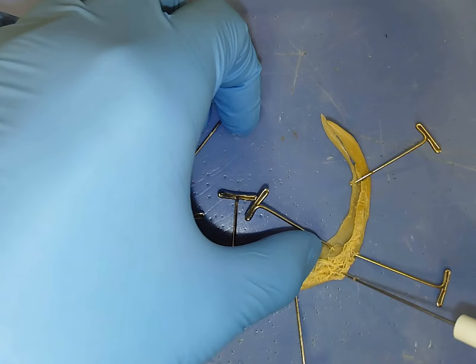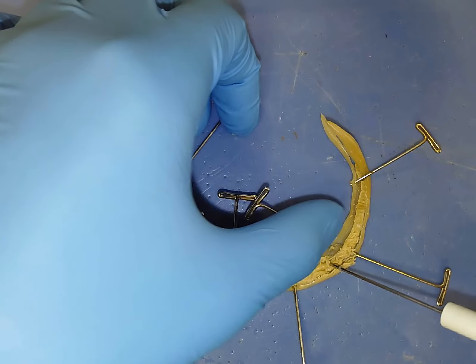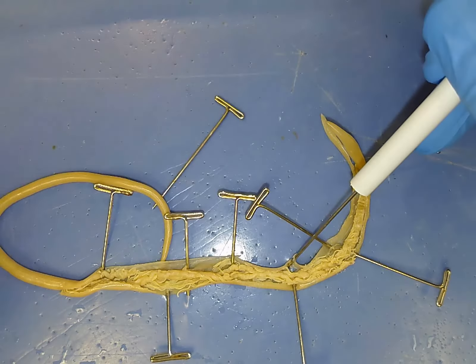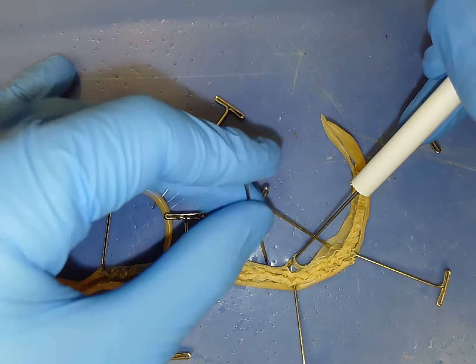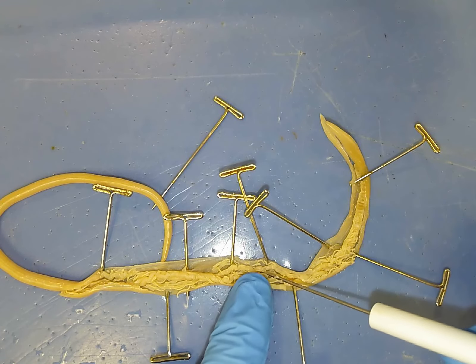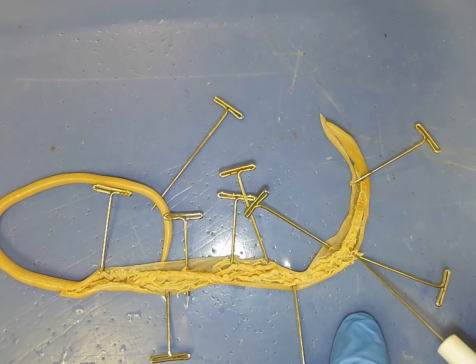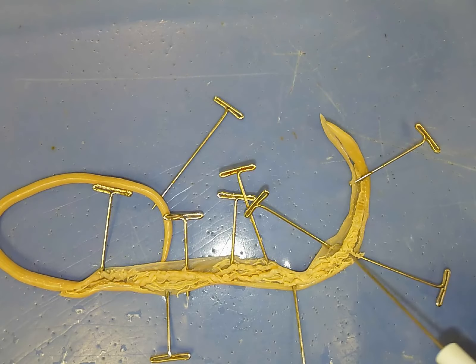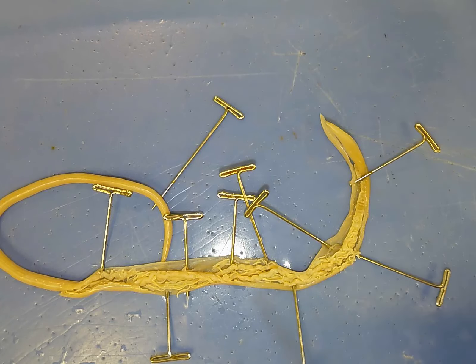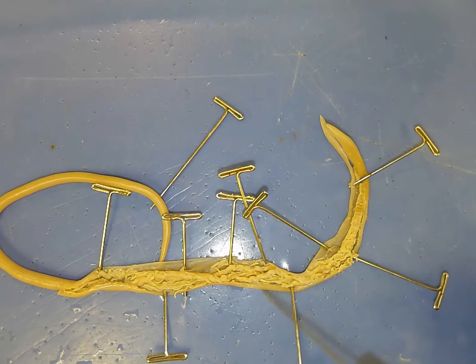The reason I can tell which side is which is the presence of these two structures. Each of these is a uterus — these large tubes that run down the length of the body. If I spread this open a little bit more, you can see there's one here and a second one right here. Each of these is a uterus, and they connect to ovaries right here. All this material that looks like ramen noodles is an ovary — these are producing eggs, and they connect to the uterus here. These ovaries run down the length of the body, connect to the uterus, and then run back up the length of the body.